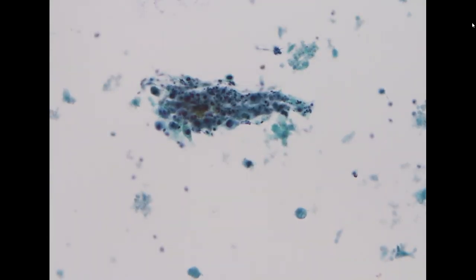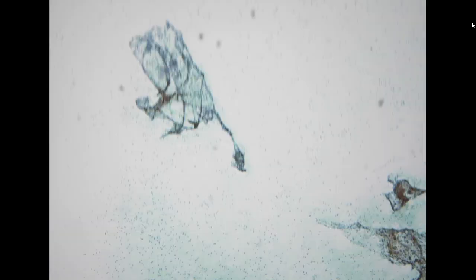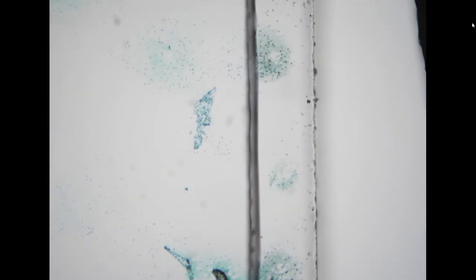So now we know we are dealing with an unusual situation. The first thing is that we need to check the history to see if the patient had a rapidly enlarging mass in the thyroid, if the lesion is within the thyroid, and if the patient has any prior history of malignancy from other organs. This is the direct smear. You see marked necrosis and inflammation over here, and the lesional cells are not very easy to find due to the marked necrosis and degeneration. So Dr. Gao did a cell block for this specimen.